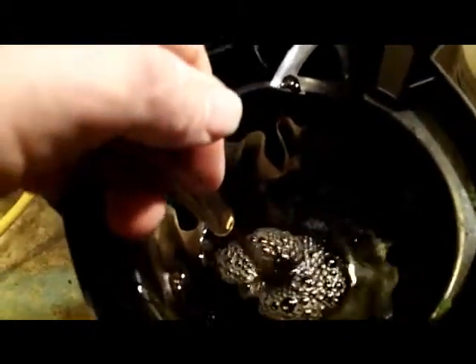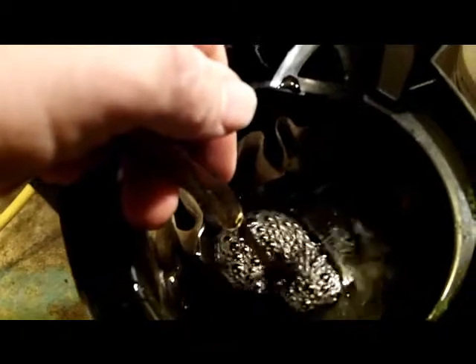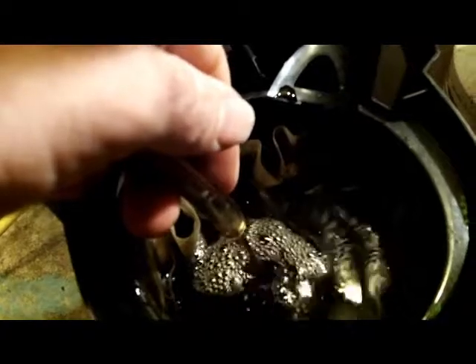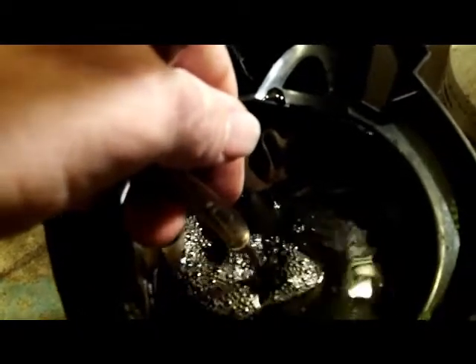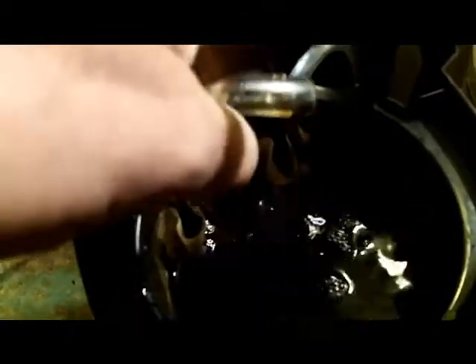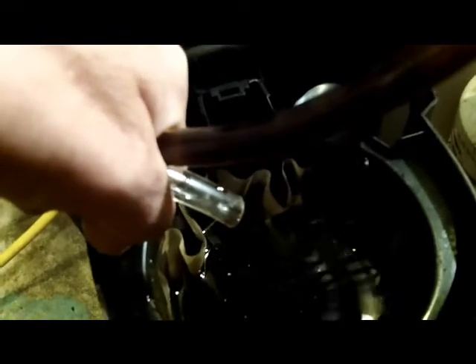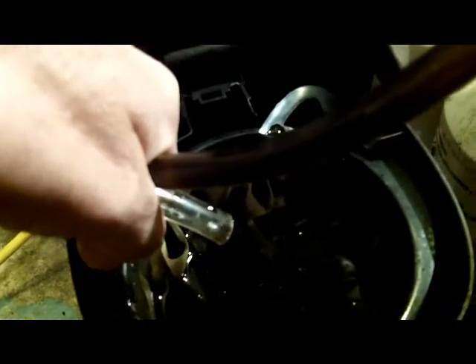What we're doing here is separating the gold from the copper and other stuff dissolved in the fluid. The gold is still solid. The other base metals and impurities are dissolved in the acid. Most of the gold will stay in the tank, but we don't want to lose any of these fragments either, so that's why we filter it.